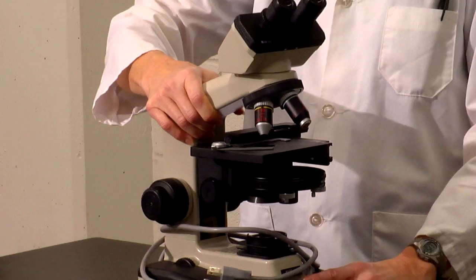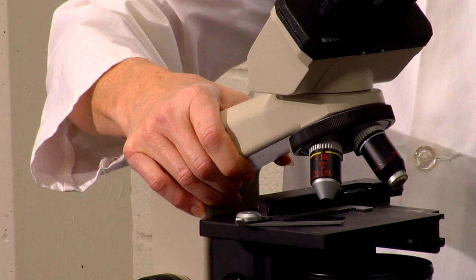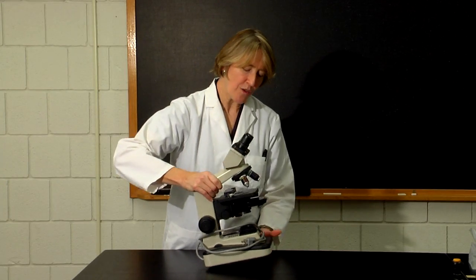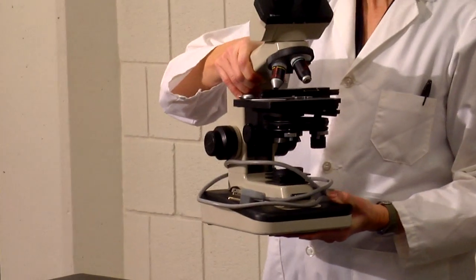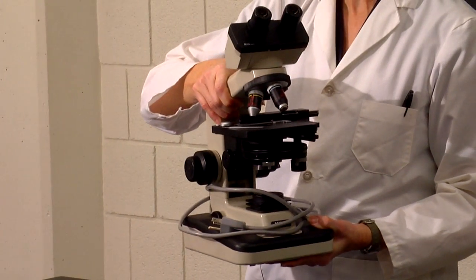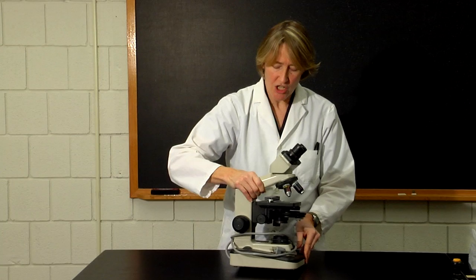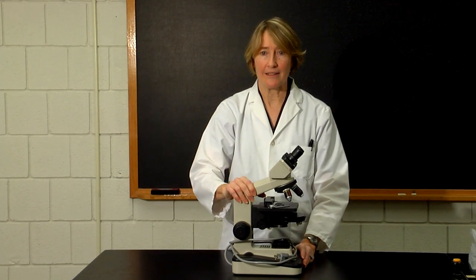Bring one of the microscopes to your lab bench using one hand to grasp the arm of the microscope, which is the part that connects the head with the base, and placing your other hand under the base. Carefully carry the microscope to your bench top, set it on the bench top in a safe position, and plug it in.